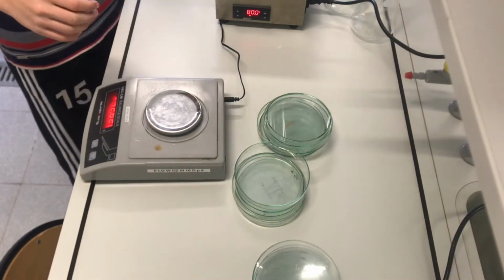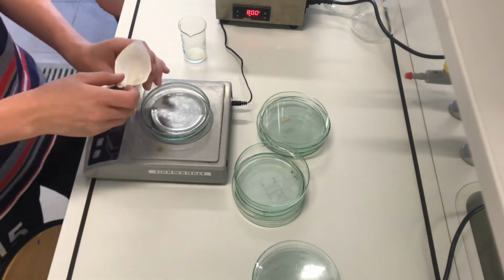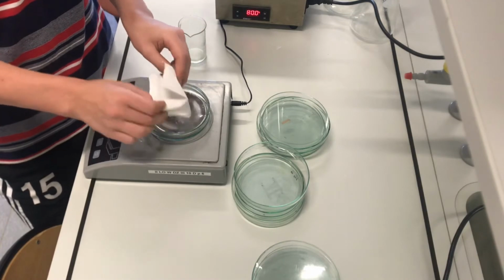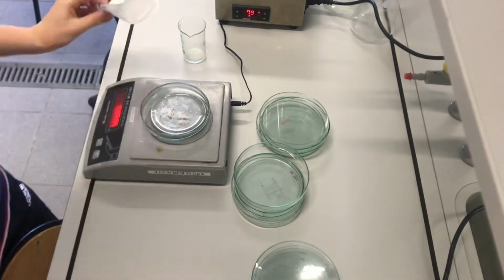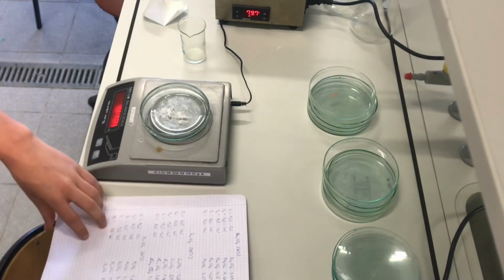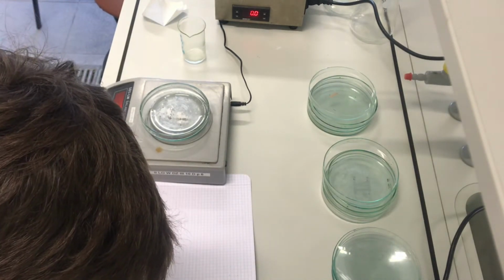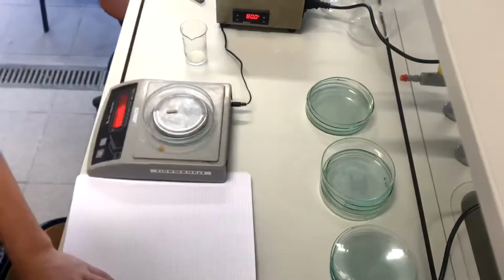I then measured the residue of the salts I had filtered the day before. To measure the residue, you must take the filtering paper, which by this time should be dry, unfold it and shove the dry salt on a scale and measure it, noting everything down. I did this for every flask.